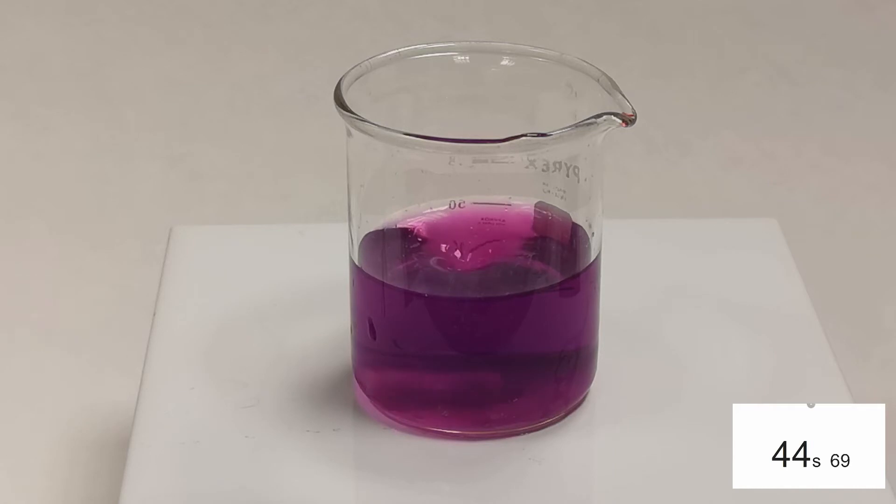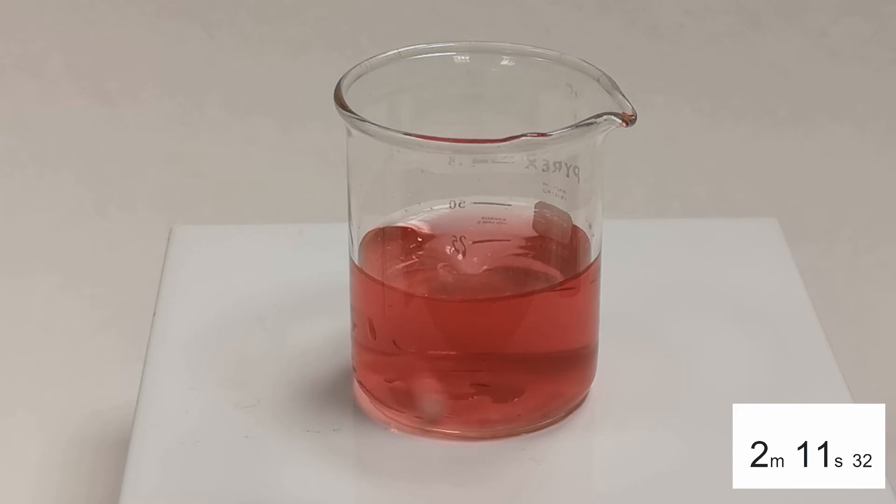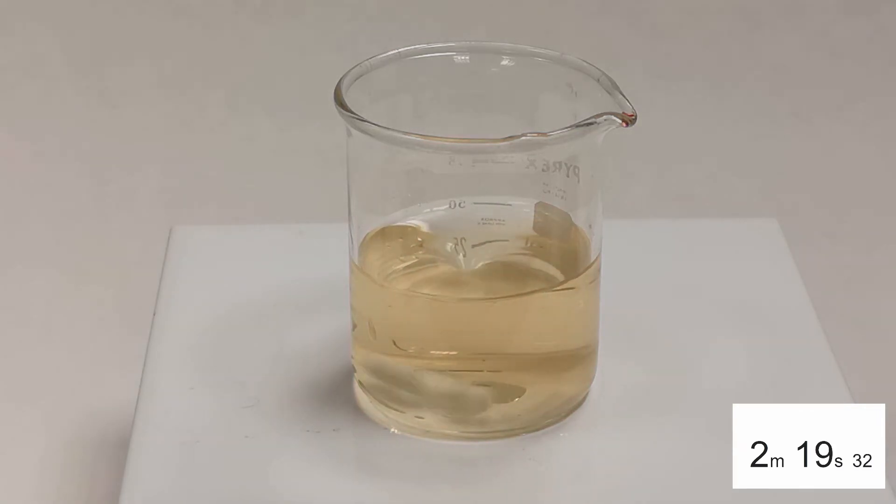Interestingly though the reaction is catalyzed by manganese 2+ ions, one of the products of the reaction. So as the reaction proceeds it does so at a faster and faster rate. You can now see that it is starting to fade. And after 2 minutes and 30 seconds in this case the solution is completely colourless.